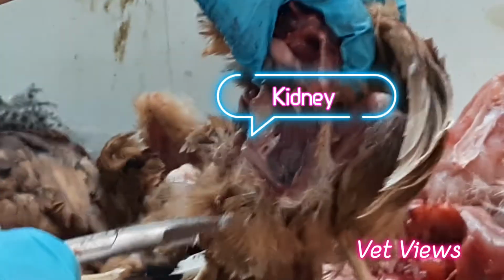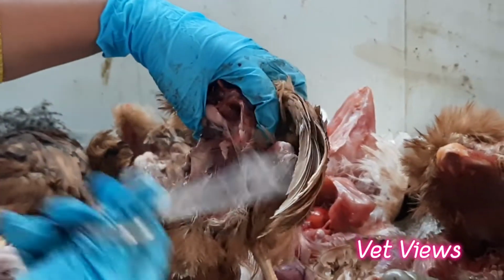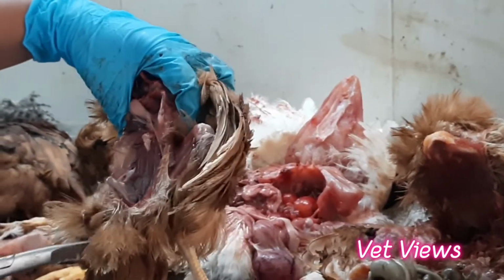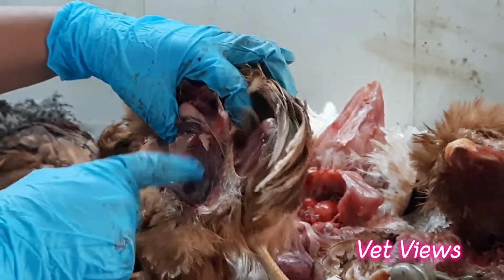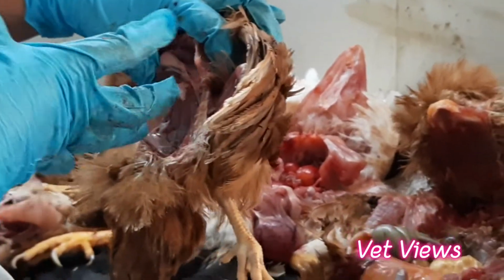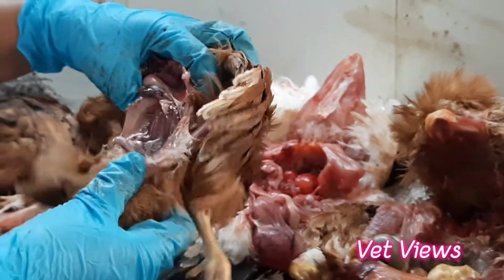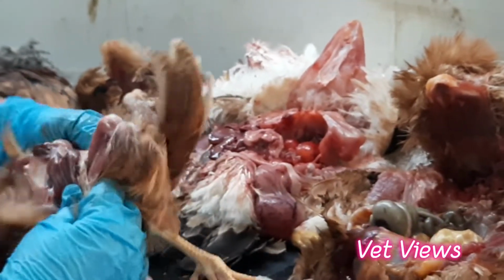This is the normal color of the kidneys. Sometimes in infectious bronchitis, there is a nephropathogenic form which affects the kidneys. There you will find, in young broilers, severe nephritis. The kidneys will get congested and there will be mottling. All these things you will observe in the kidneys.